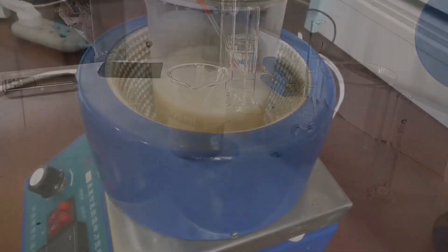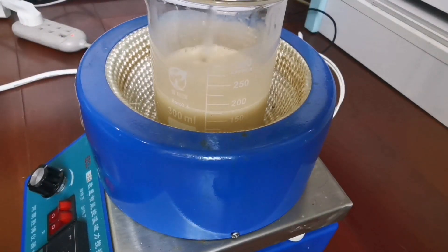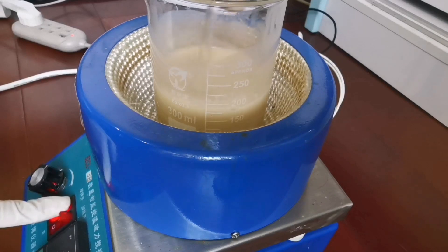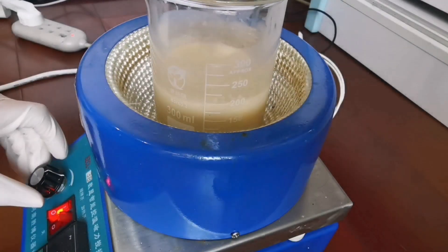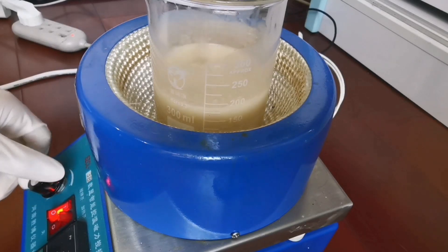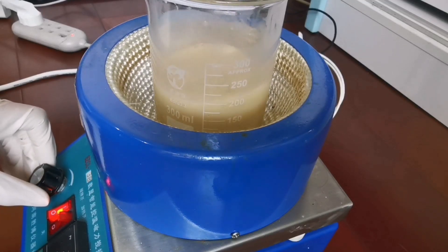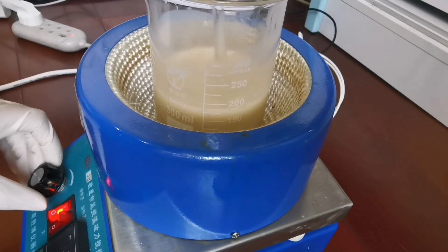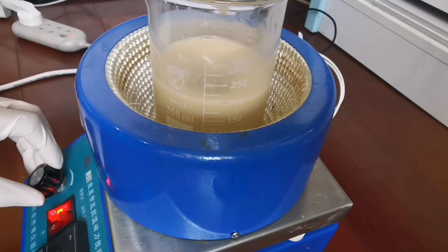After a while, I think my mixing machine will do a better job. I drop the stir bar into the beaker and I turn the stirring on. The bottom of the solution is a bit sticky, so I need to help my stir bar with my spoon. After a bit of stirring, I successfully started it up.